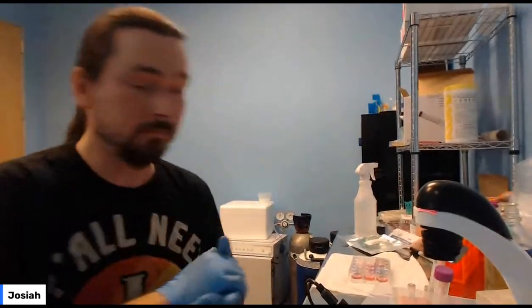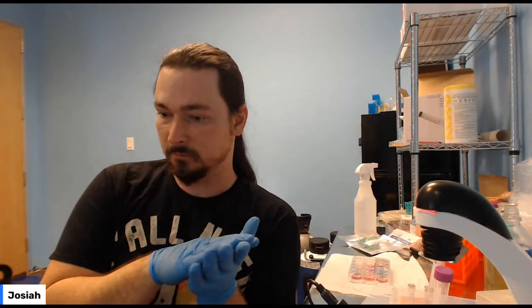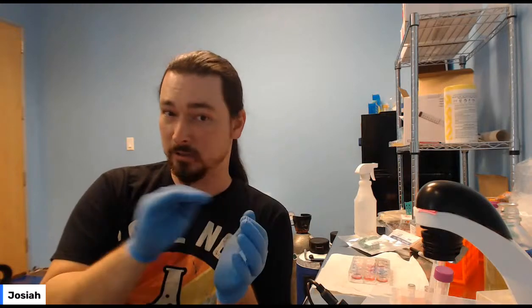And honestly, if you did it right and you wait 48 hours, you add the X-Gal, it starts to turn blue within like an hour usually. So you can watch it and come back and check, and come back and check, and you can watch it get blue.